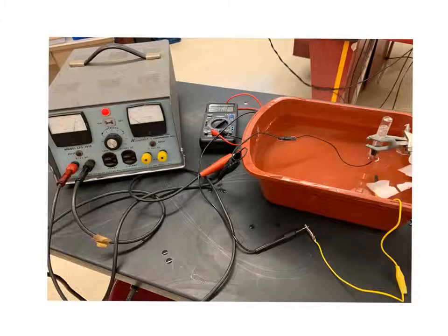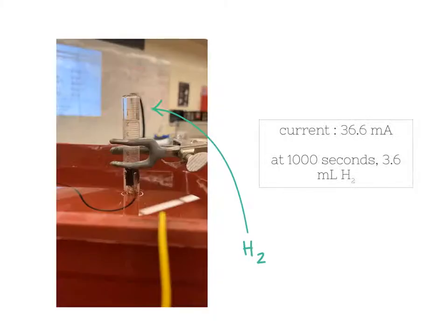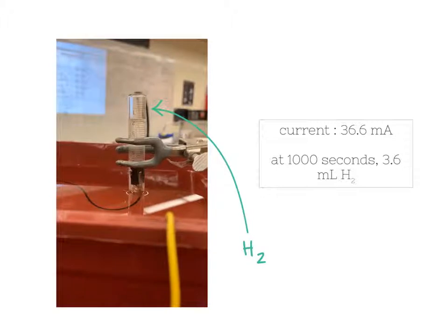Now this is our setup. We've got the negative terminal wired to our cathode, and hydrogen is being collected up at the top of the graduated cylinder. For this, we only decided to measure hydrogen, but oxygen is still being produced at our anode right there. We've got an ammeter wired in, which will allow us to measure the current, but I will explain why later. So here you can see the hydrogen being produced, the bubbles moving upwards at the cathode.